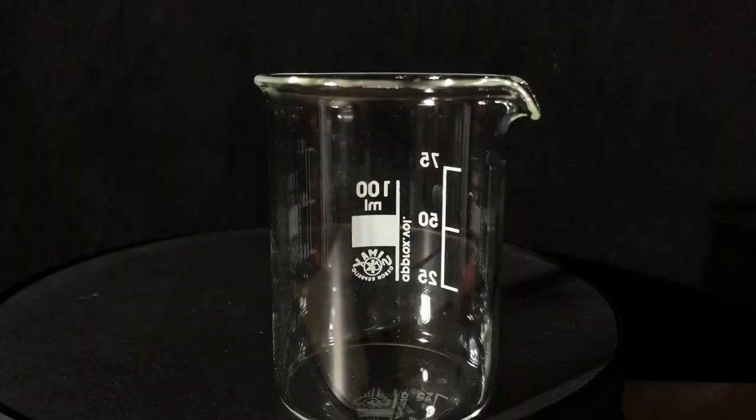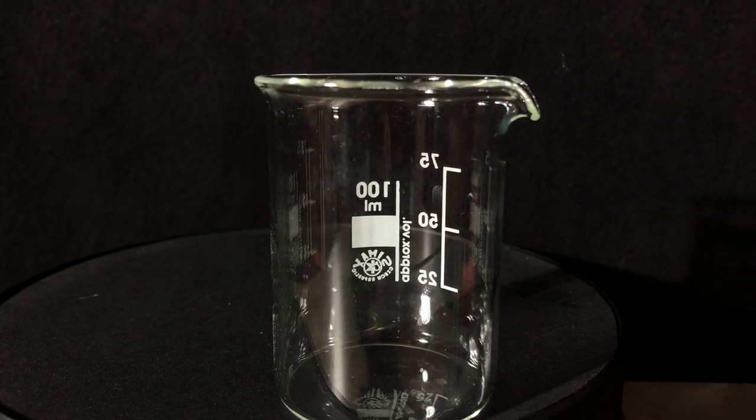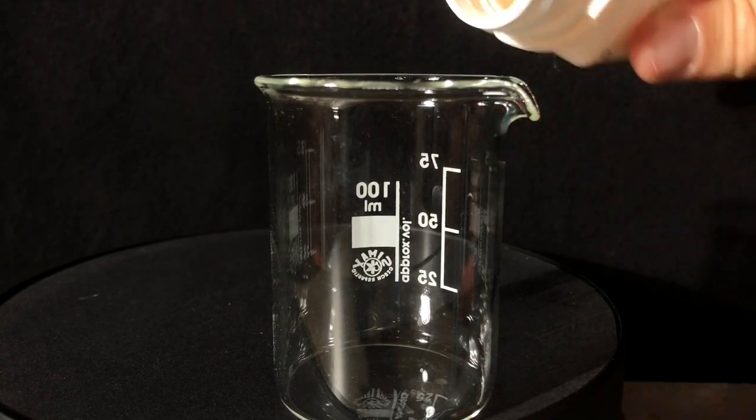When silver nitrate touches your skin, your skin will be stained black. Therefore I made sure not to touch the silver nitrate.